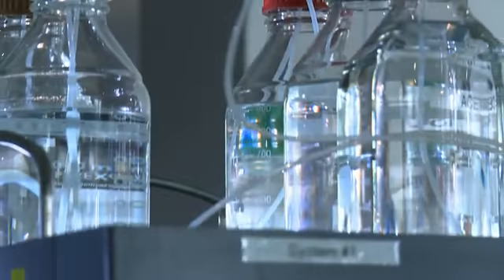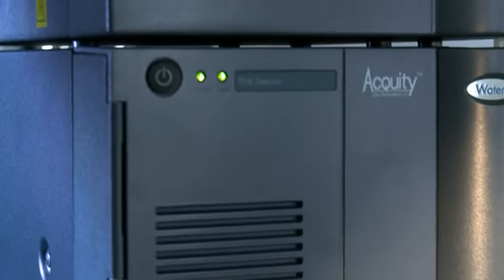running routine analytical methods. Because we're still working with bottles of pure solvent and concentrated modifier, we don't have to make up as many bottles of solvent. We don't have to make as many measurements. That obviously means less effort on our part and also fewer opportunities to make errors in the preparation of the solvent. I hope this short overview of the ACQUITY UPLC H-Class Quaternary Solvent Manager has been interesting and useful.